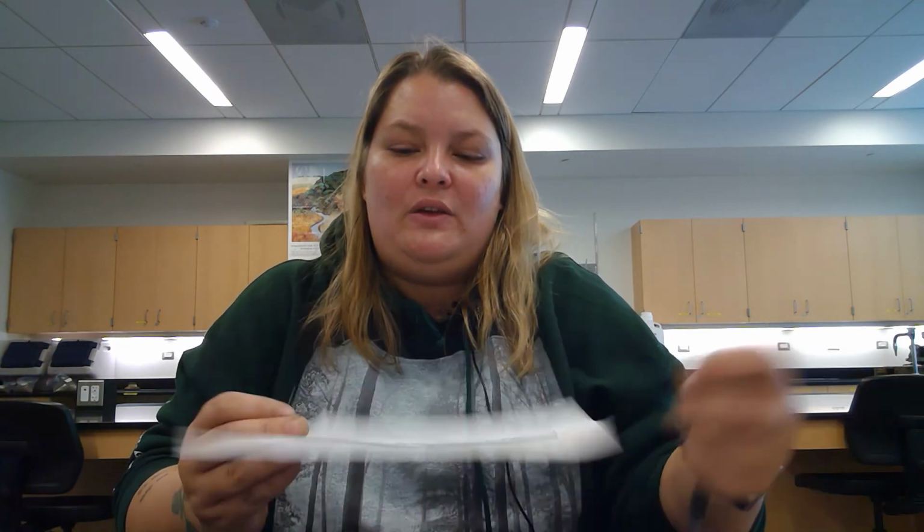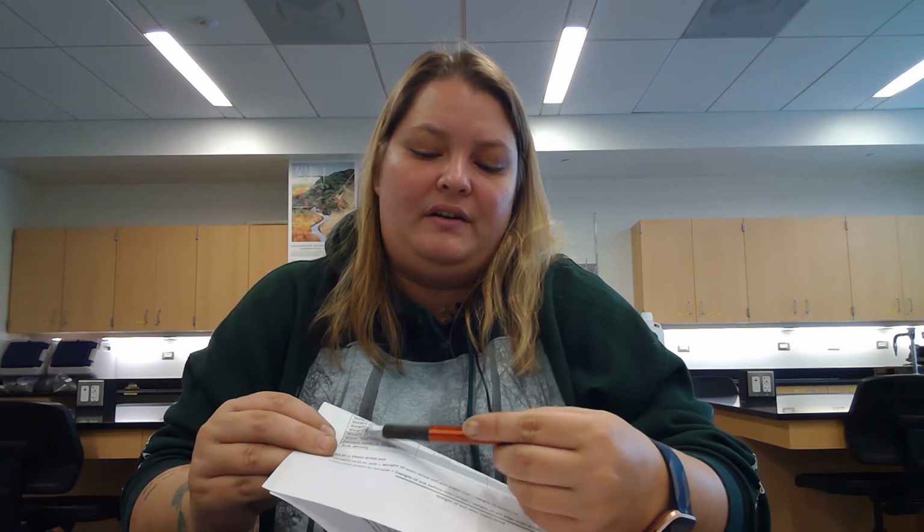So, you should have been able to fill out your sheet as I went along and did these. And the areas where I have blanks, you should be able to calculate those answers. The only thing you can't turn in right now is this shaded part, because this is where the weight of the oven-dried soil starts.